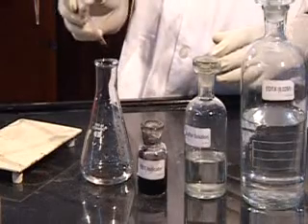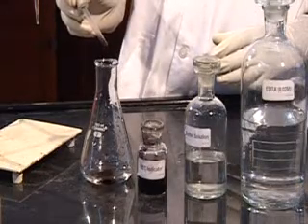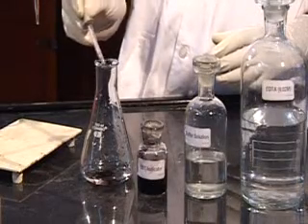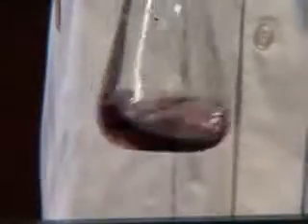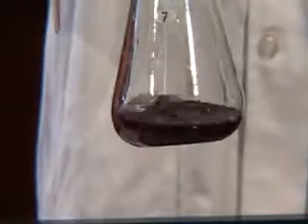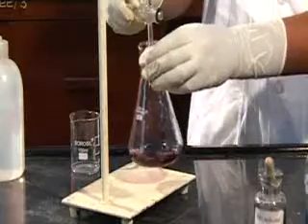This is the initial color before titration. Then we are supposed to titrate it until this color turns to blue. So I am going to start the titration.